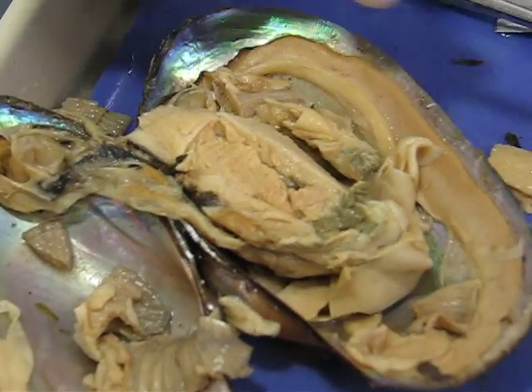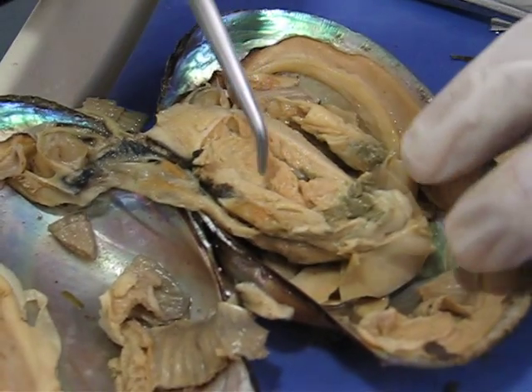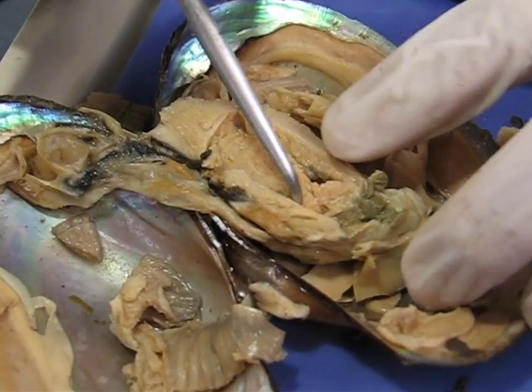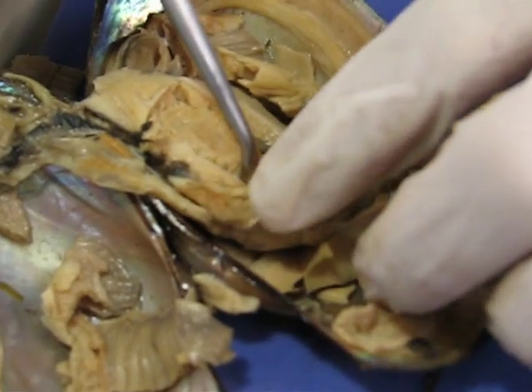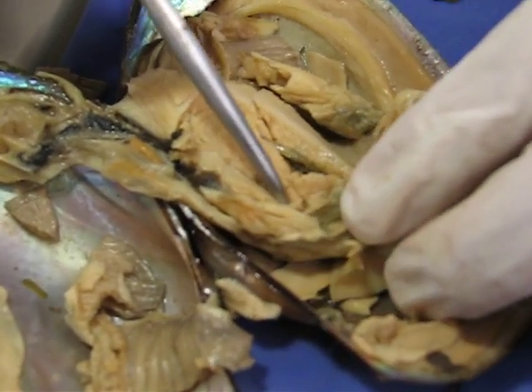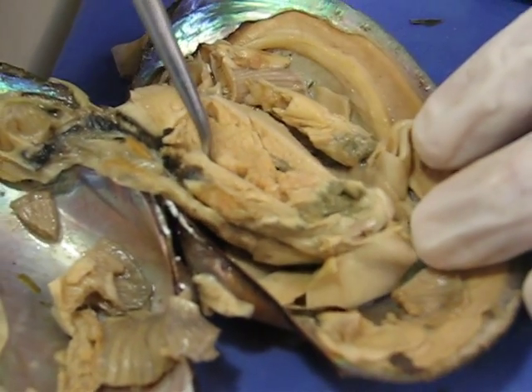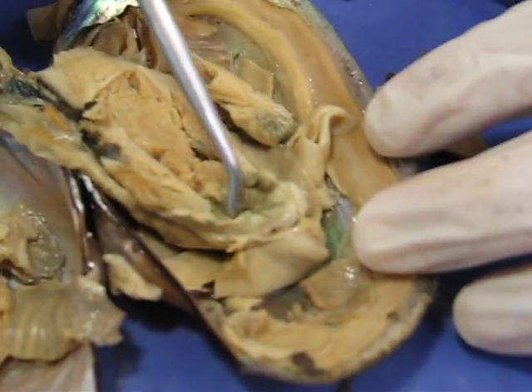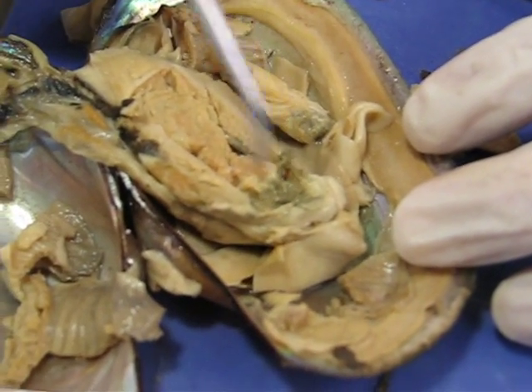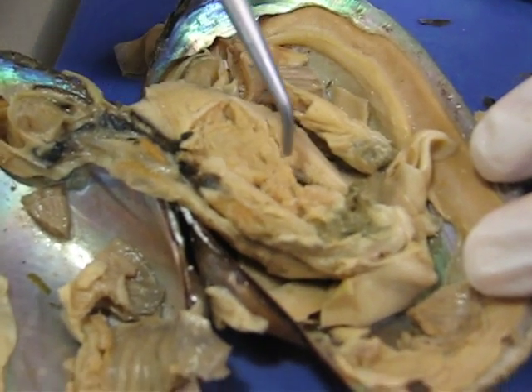Here we have opened up the visceral mass, and we can see a couple of things. We can see the digestive tract here, including the stomach — this space in here that I've kind of torn apart right inside there. We can see the green digestive gland, and we can see the gonad surrounded inside there.